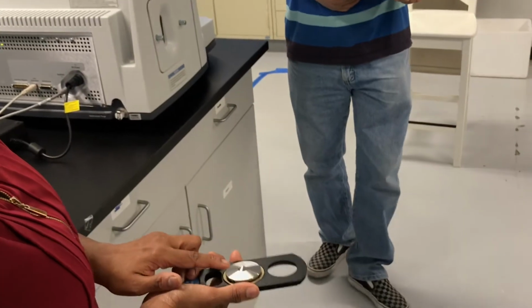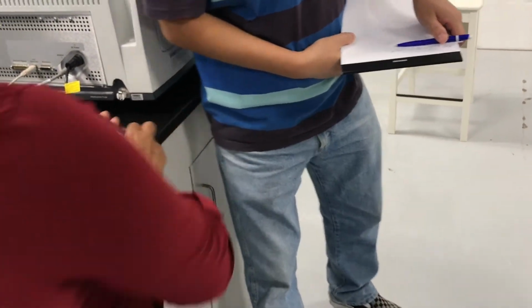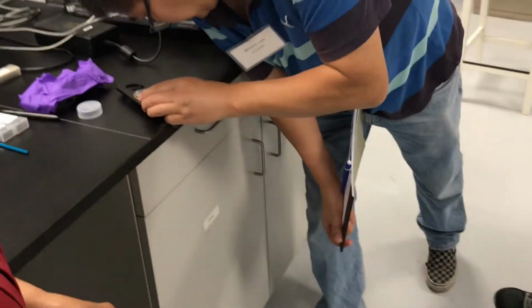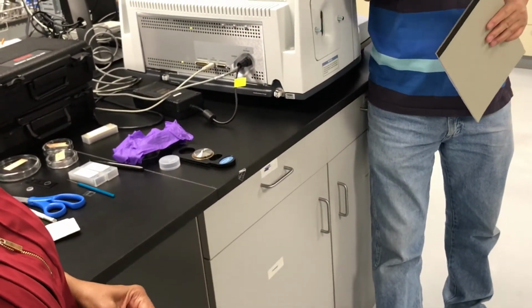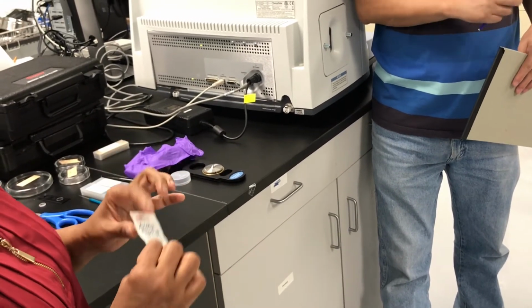As you can see, it's a very fine tip. So cleaning it up, usually I have all these wipes. So I use the wipes, the alcohol wipes, but you can think about it. If you want to get some lens cloths in your lab, there are lens cloths available with IPA as well. They're pretty pricey.